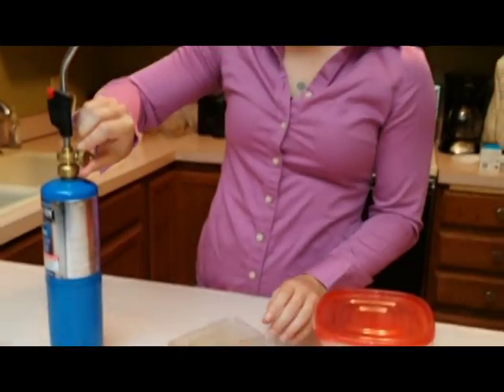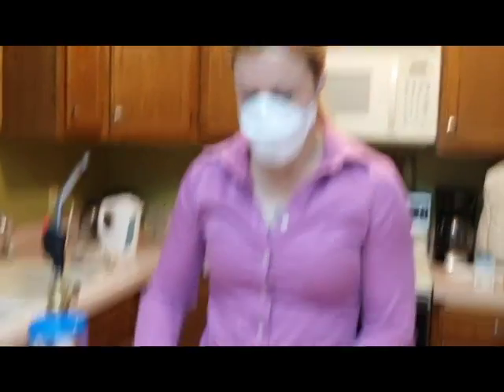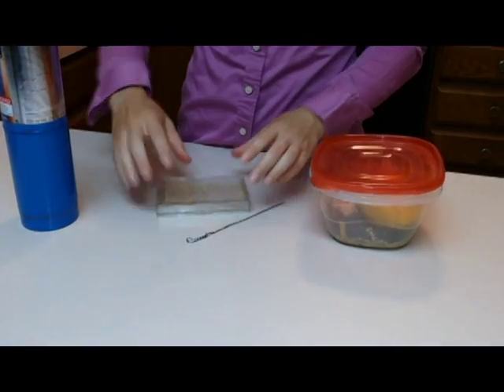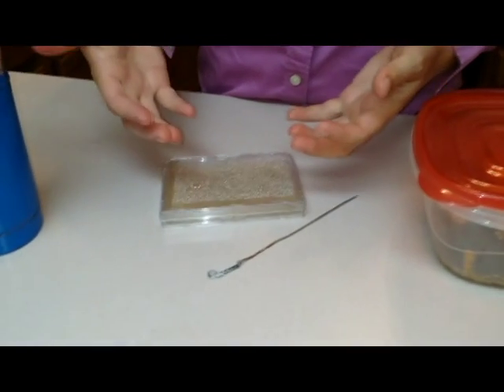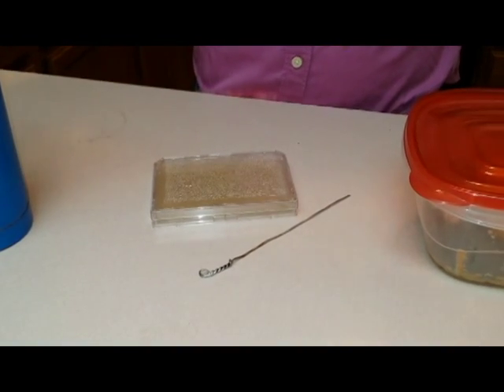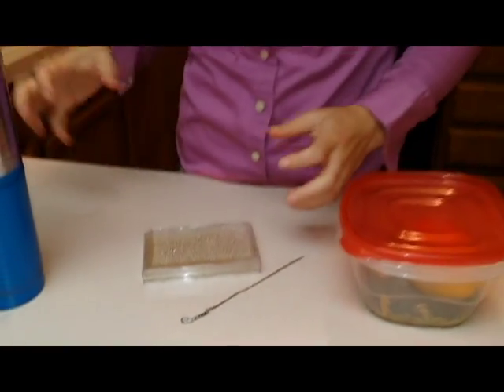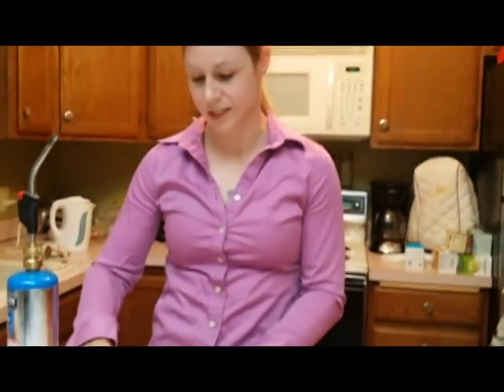So what you want to do now is flip the plate over when you incubate it. You can see that it's got some condensate right there. And you don't want that to sort of glom together and drip onto your plate because then all your single colonies will sort of mush together.